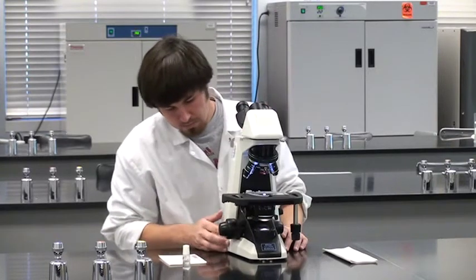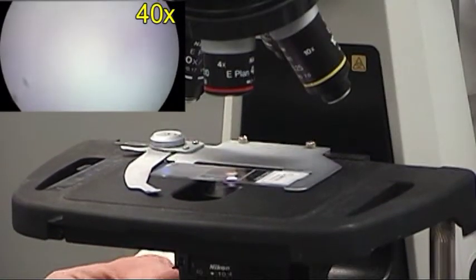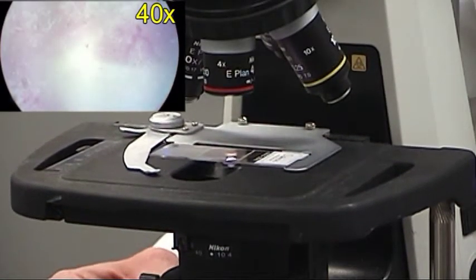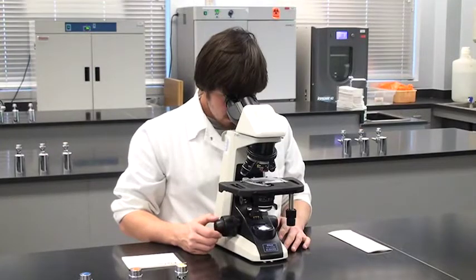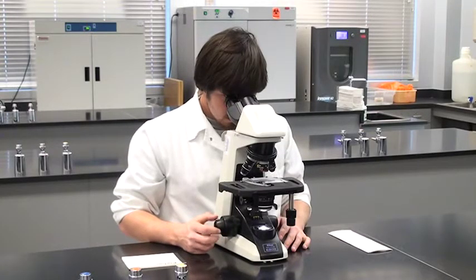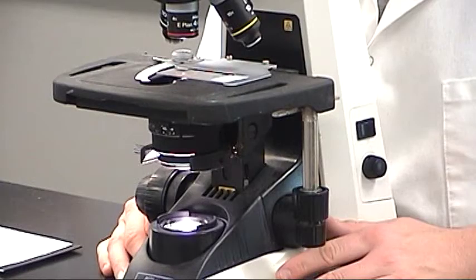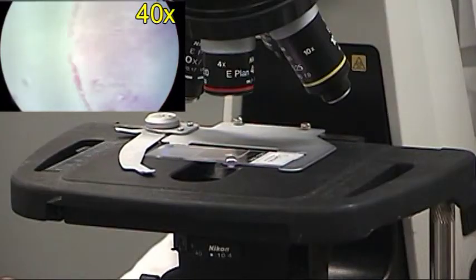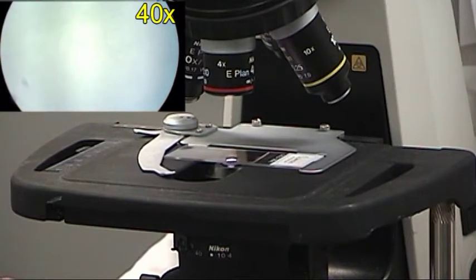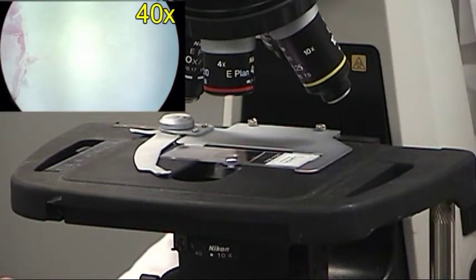Adjust the iris diaphragm so the image is bright but at a comfortable level. Slowly turn the coarse focus knob to raise the mechanical stage until the slide specimens come into focus. When the organisms appear to be in focus, use the fine focus knob to sharpen the image. Now use the XY knobs to move the slide as you scan it for a specific organism. When you move the stage in one direction, the image moves in the opposite direction because it's inverted.